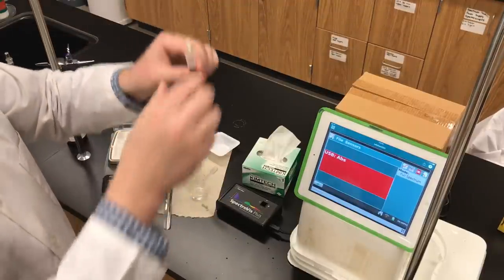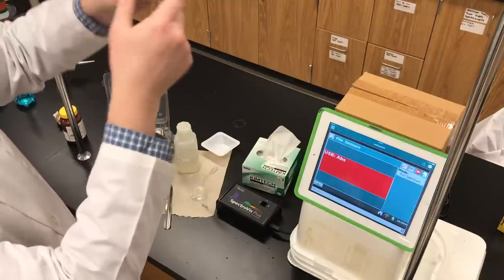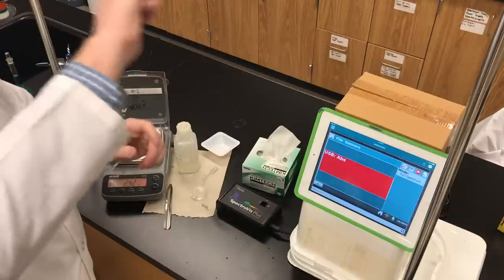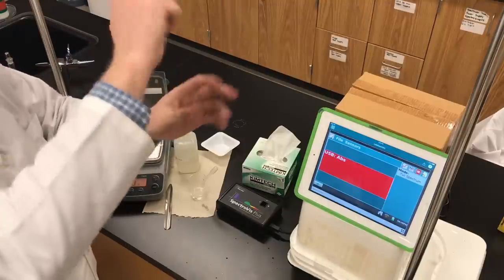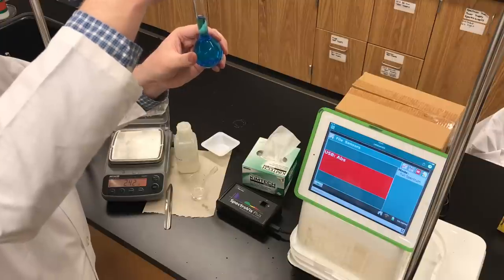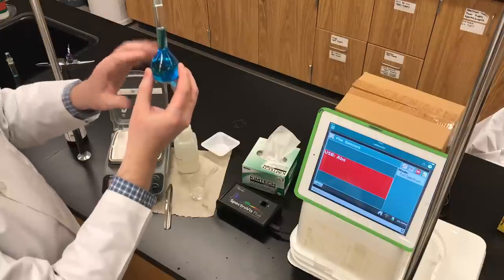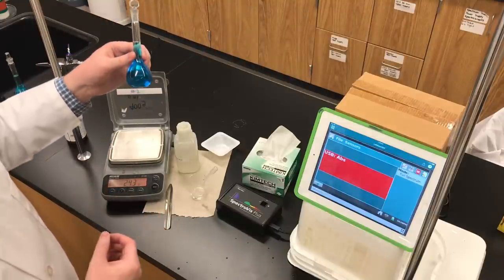The meniscus is perfectly touching the line in the neck of the volumetric flask. I'll stopper it, turn it over — letting it breathe between inversions — and do that about three times to mix the solution so it will be homogeneous, with equal concentration everywhere. There we have 50.00 milliliters of a standard solution of copper-2-nitrate, prepared using copper-2-nitrate trihydrate as the solute.